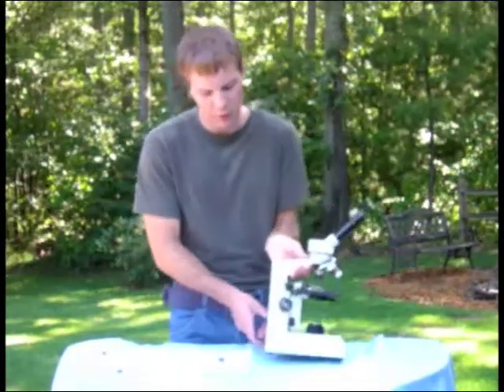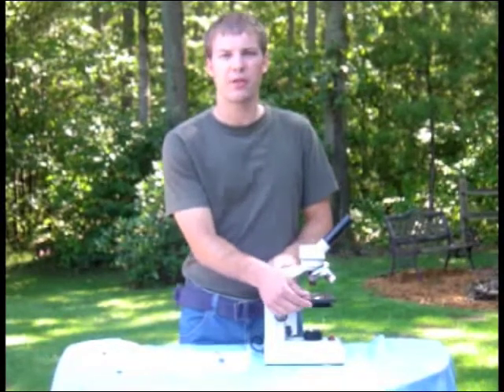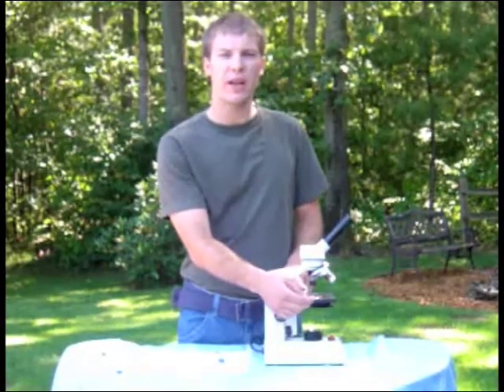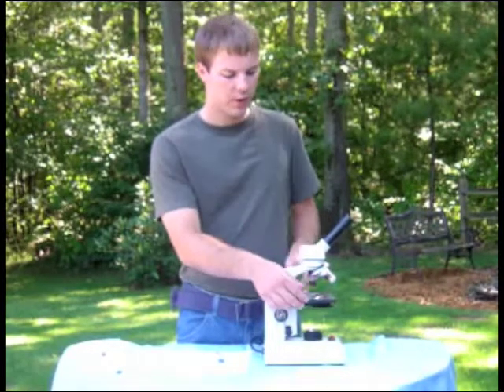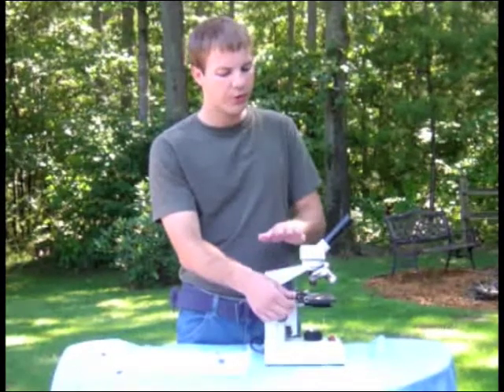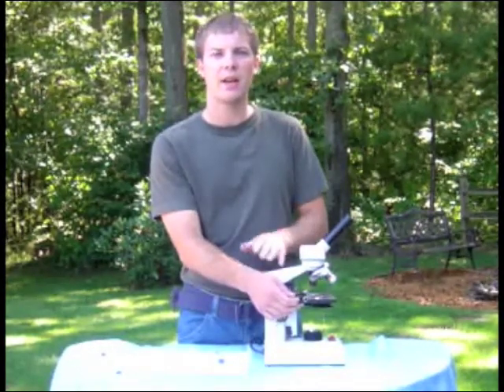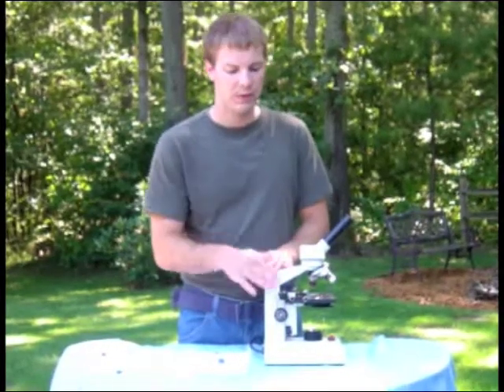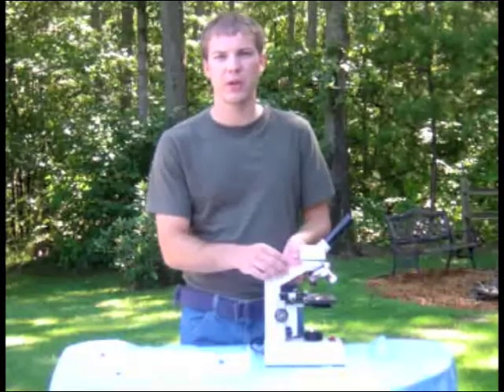The third thing you will adjust is the mechanical stage. These microscopes are equipped with two knobs that will move your slide left and right, and up and down. Once you put your slide in, by twisting these knobs you can move the slide around the stage very smoothly and at a constant speed, which will allow you to observe everything that's on the slide.